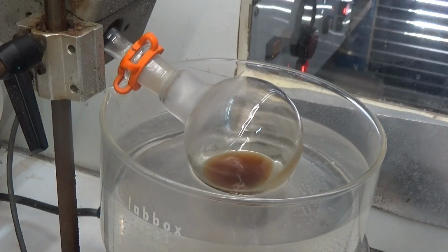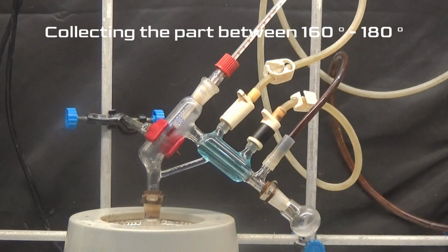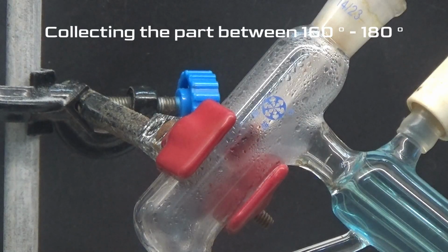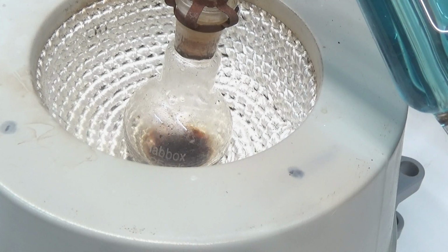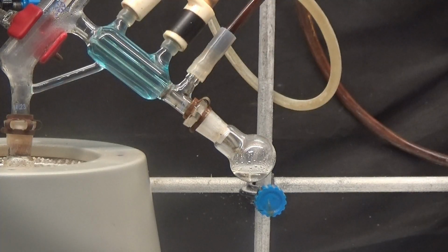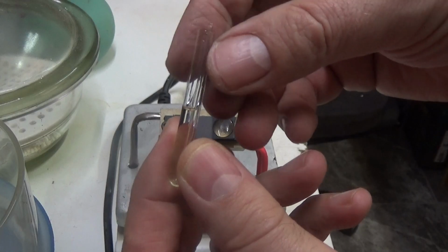A brown-colored oil is obtained. The oil is vacuum distilled, collecting the part between 160 and 180 degrees. We determine the boiling point of the product obtained.